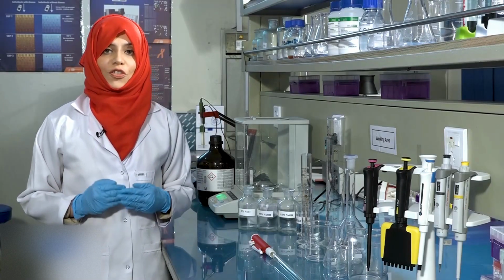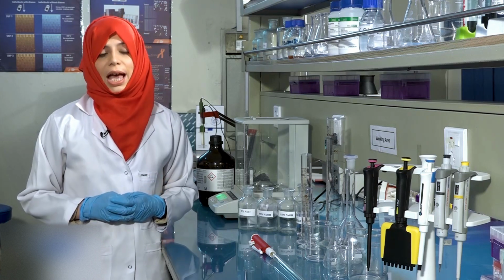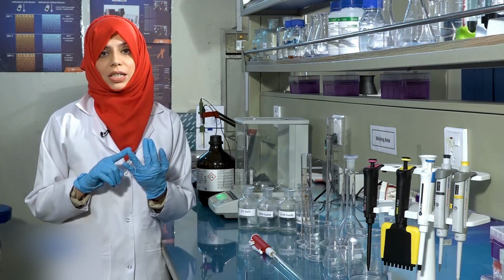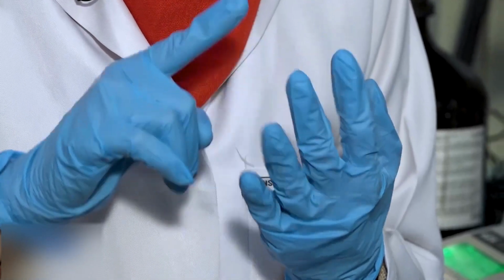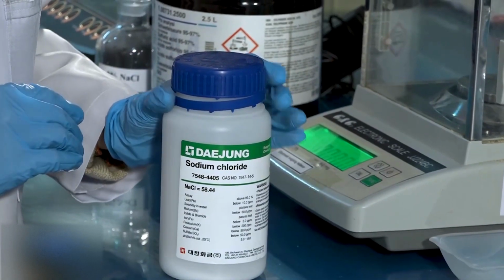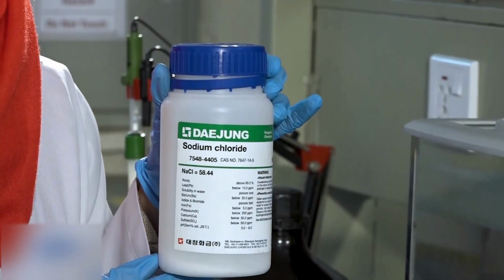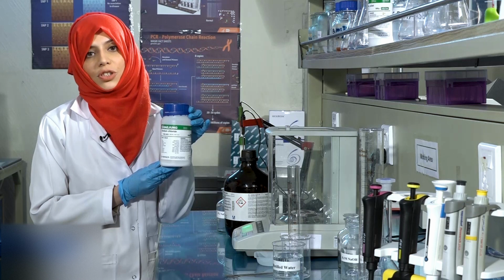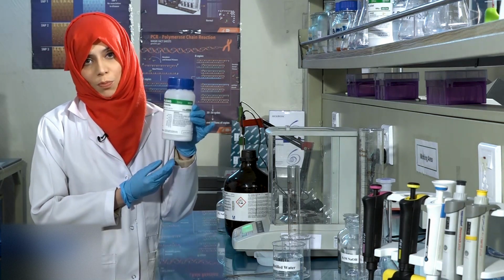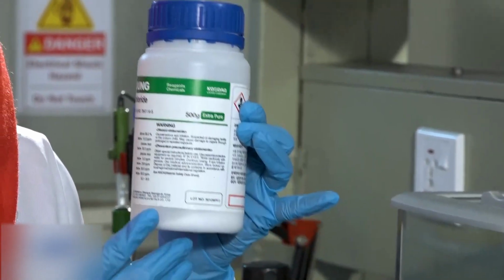Concentration is a measure of the relative proportion of solute and solvent present in the solution and can be measured in terms of percentage, molarity, molality, and normality. Now that we have learnt calculations, we will be preparing a 2% solution of sodium chloride. Whenever using reagents or salts in the laboratory, ensure that you read the expiry date on the bottle and read any warning or hazard instructions that are given on the label of the bottle.